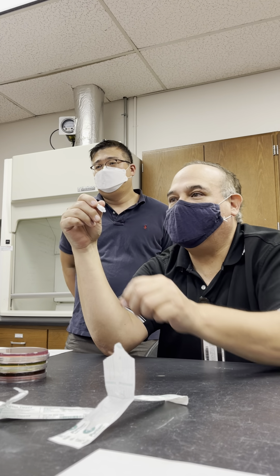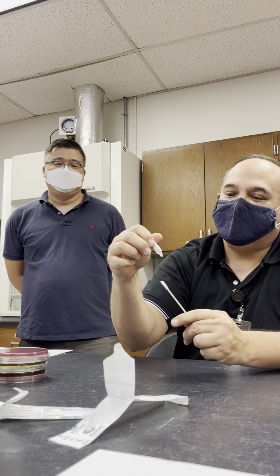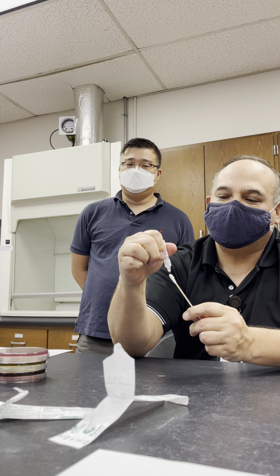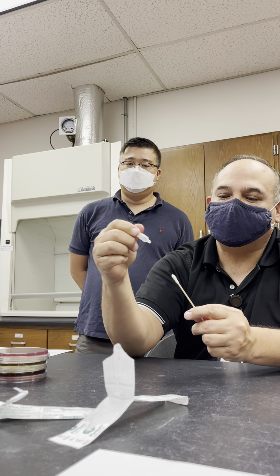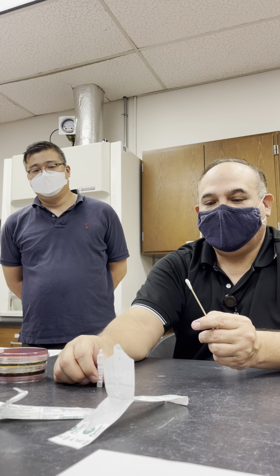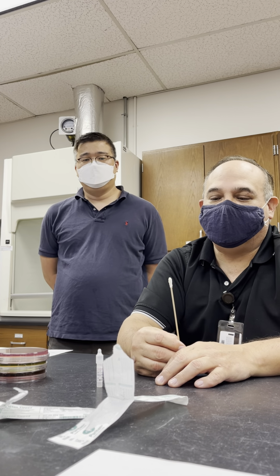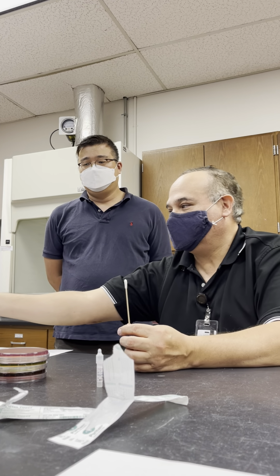You too could be a microbiologist. Okay, here we go. So now I'm going to go ahead and put the reagent on there. 1001, 1002, 1003, 1004, 1005, 1006, I'm trying to give it more time, 1007, 1008, 1009, 1010.